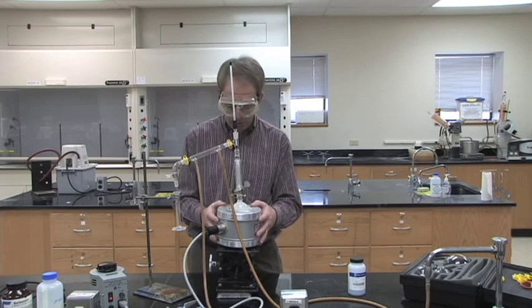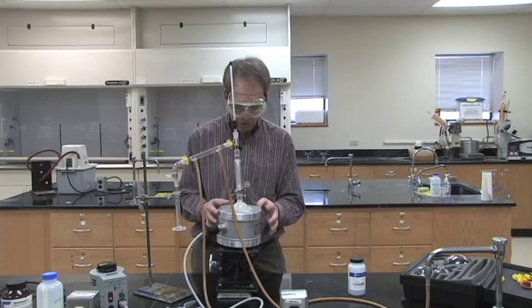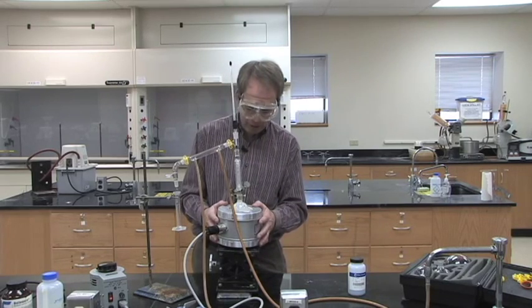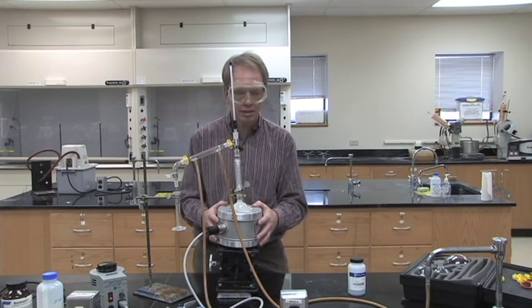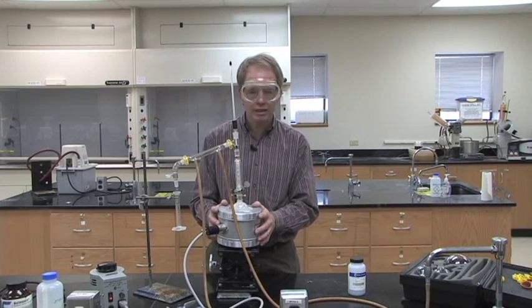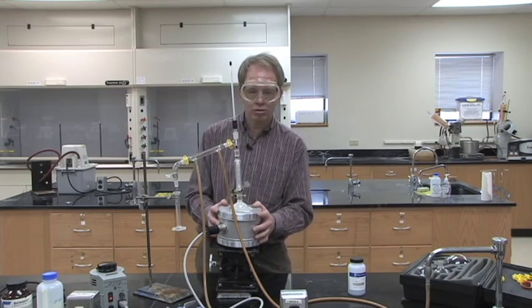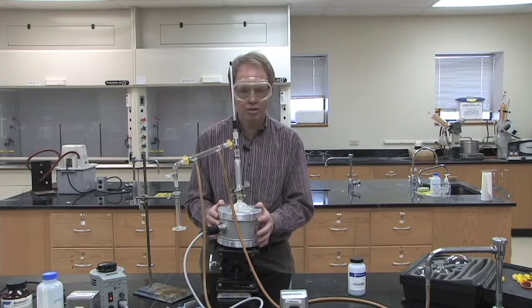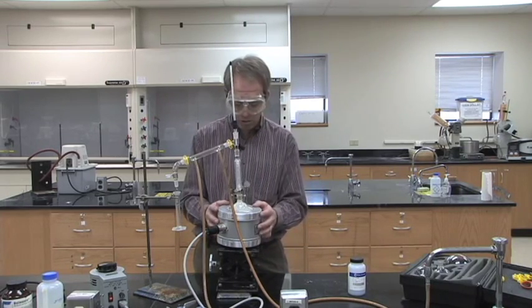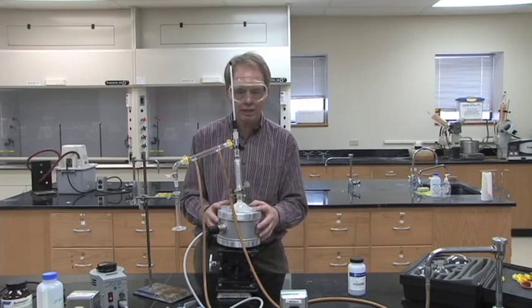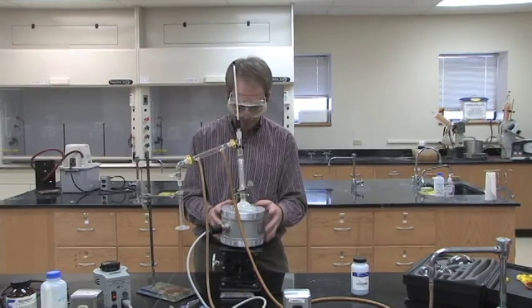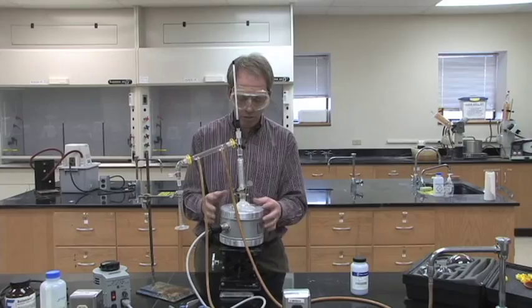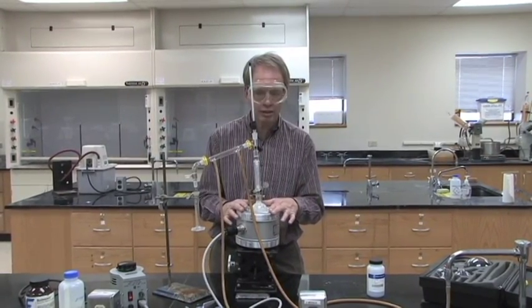In lab five we're doing the fractional distillation. Some of you will use ethyl acetate and butyl acetate, some of you will use heptane and pentane, depending on what your instructor wants you to use. You'll have a mixture of 50-50 of the two liquids you'll pour in there.